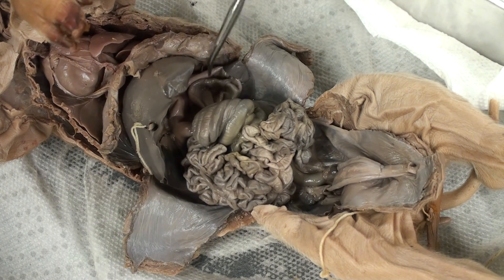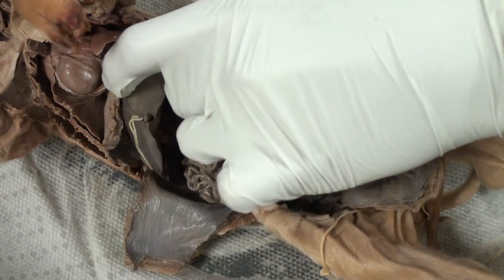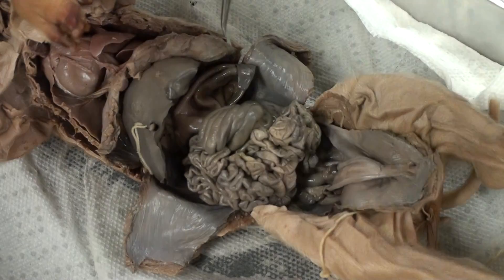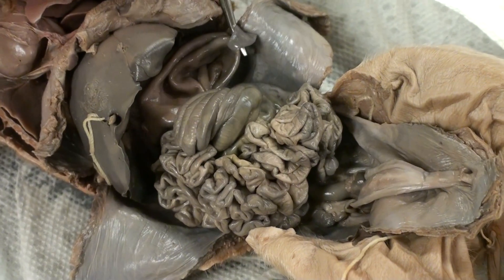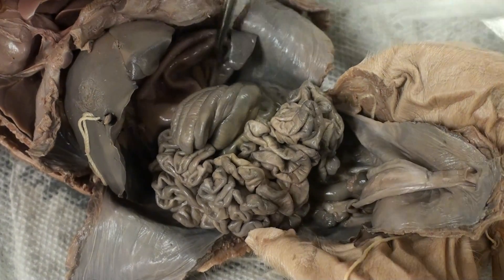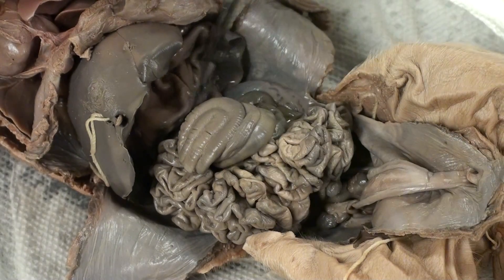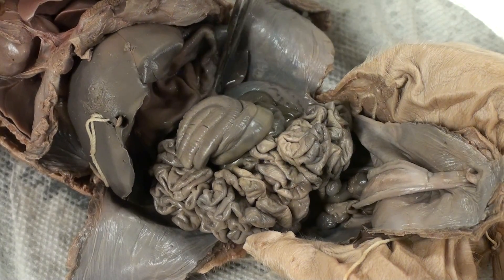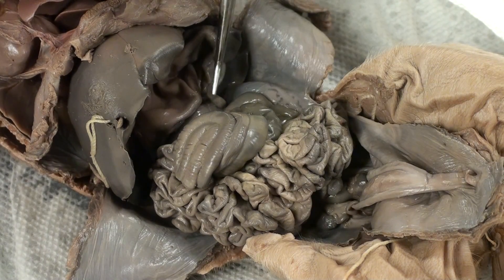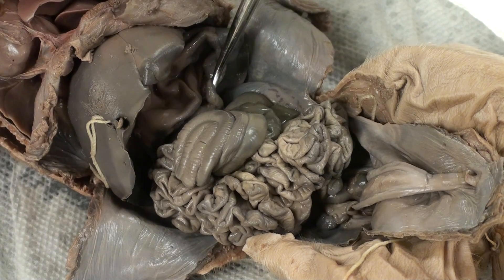Located on the left side of the pig, the tongue-like structure right here is the spleen. Located beneath the stomach, the cottage cheese-like structure over here is the pancreas.